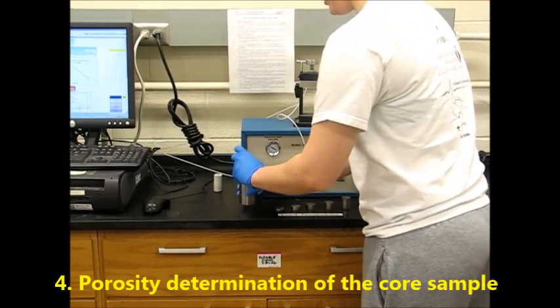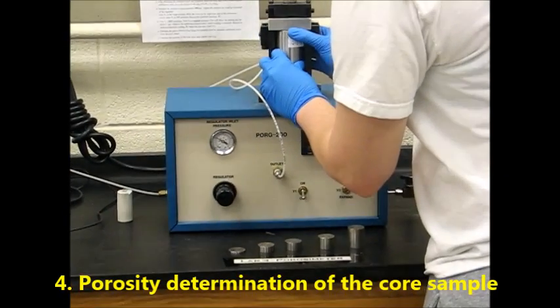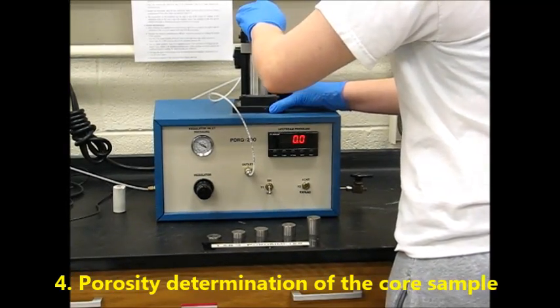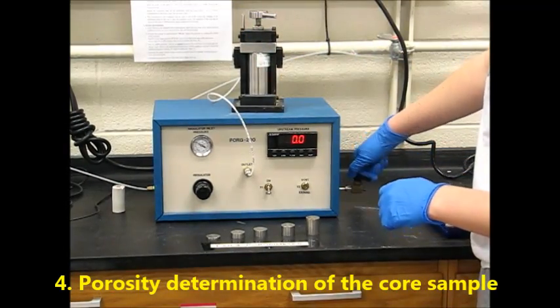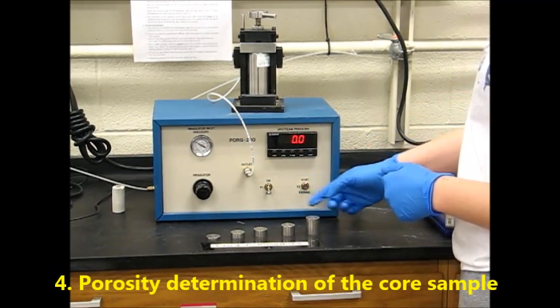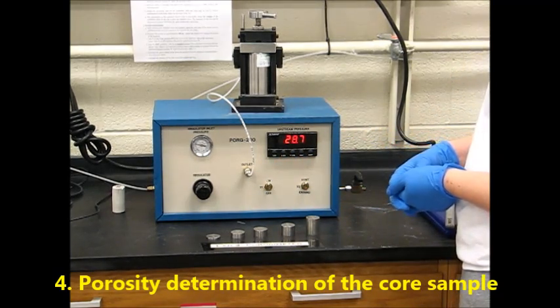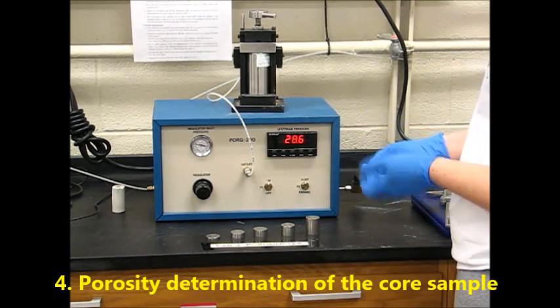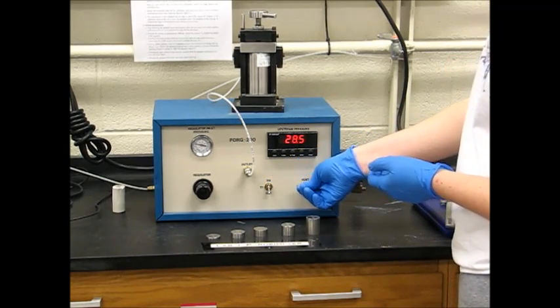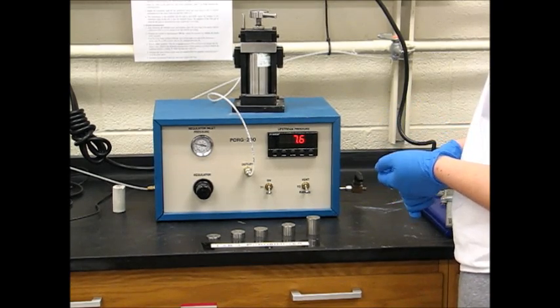We're going to place this in our matrix and make sure it's equal on both sides, and then tighten the lid. Make sure that the rear valve is turned to off. We're going to turn V2 to the vent position and then turn V1 on and record pressure 1 for our core sample. Once that is stabilized, record that, and then we'll turn V1 to the off position and V2 to expand. Once that is stabilized, we'll record that as our P2.